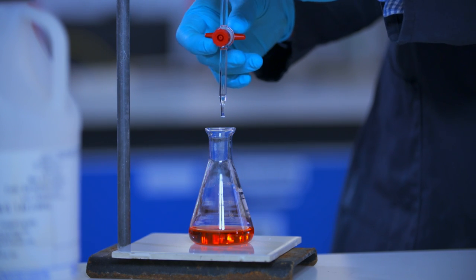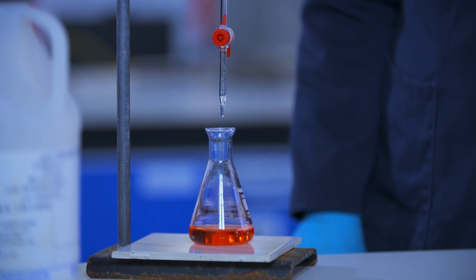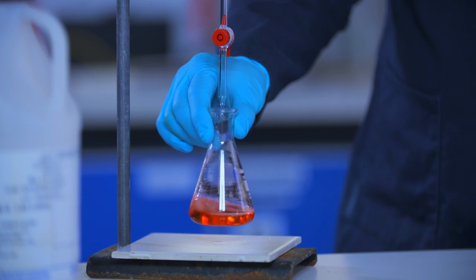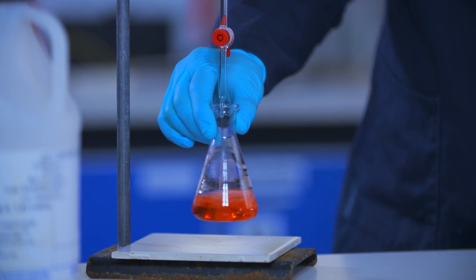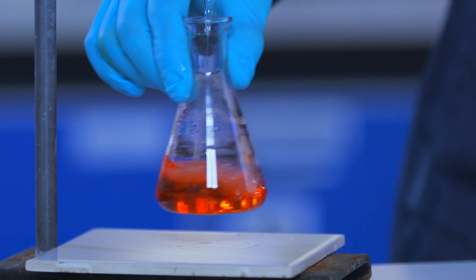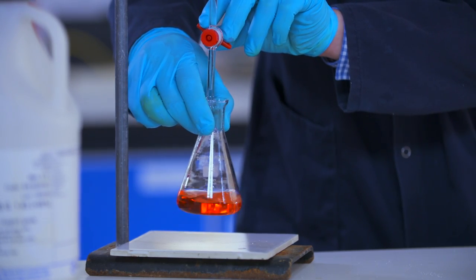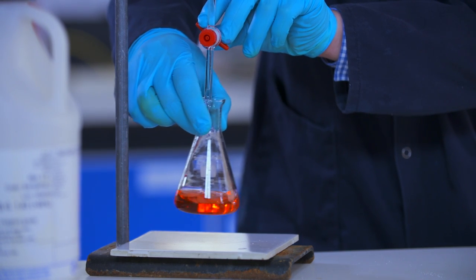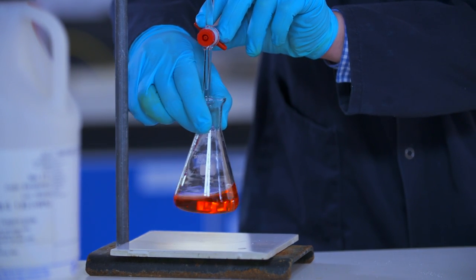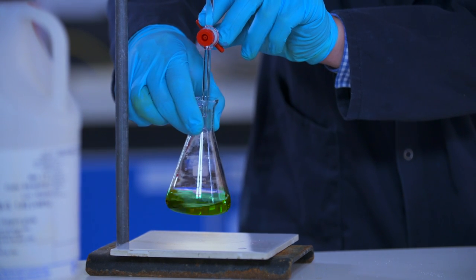Now I'll open the tap and allow the solution to pour into the acid. Once the colour begins to change, we are close to neutral, so I'll slow right down and allow the solution to mix thoroughly before adding more. Now drop by drop the base is neutralizing the acid. Once the solution is green, we can note down the final burette volume and subtract that from the initial volume.